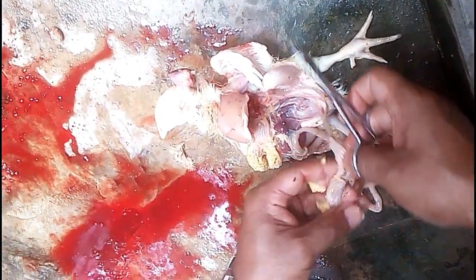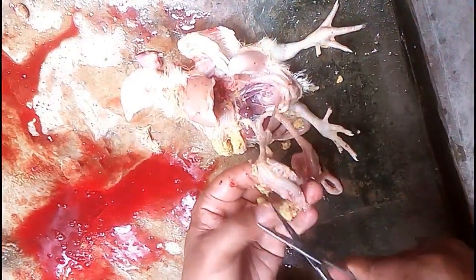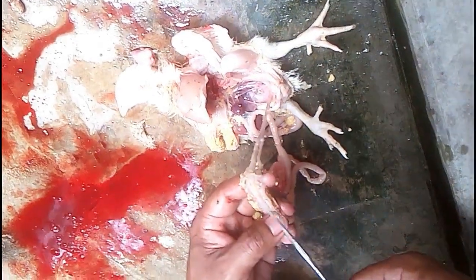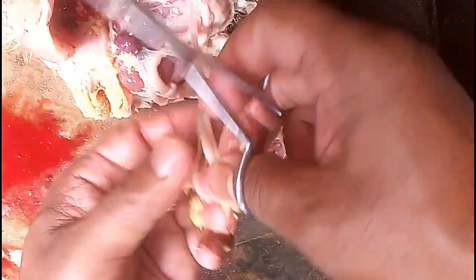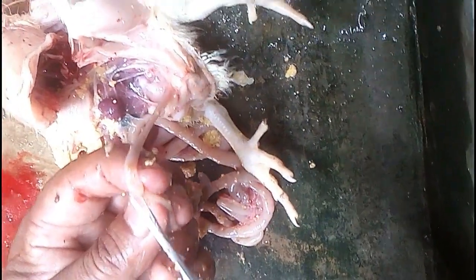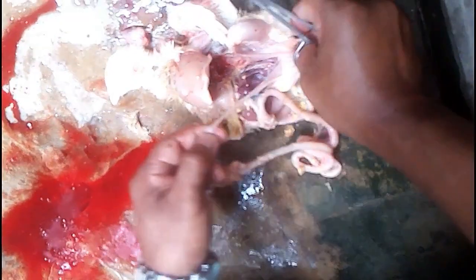This is the cecum. We open the cecum to observe any abnormalities, and then we try to open the cecal tonsil to closely observe it and identify post-mortem signs.